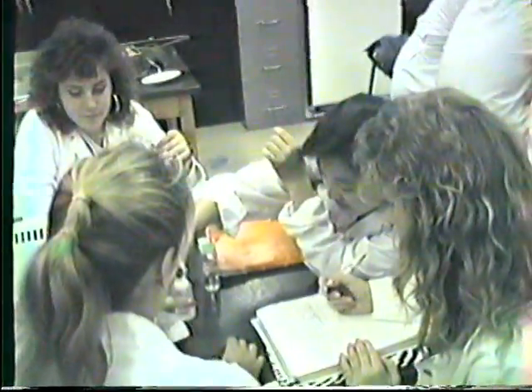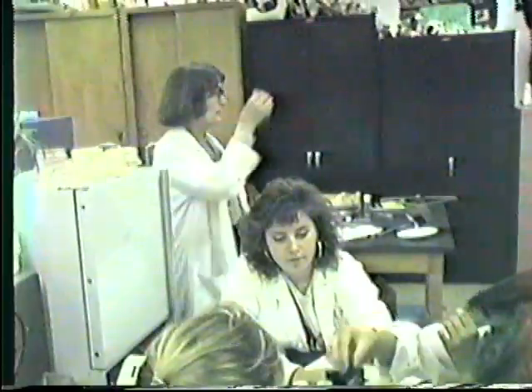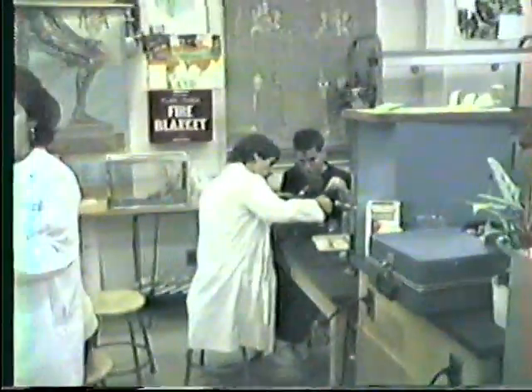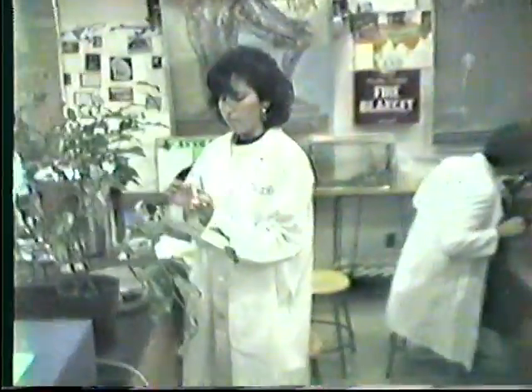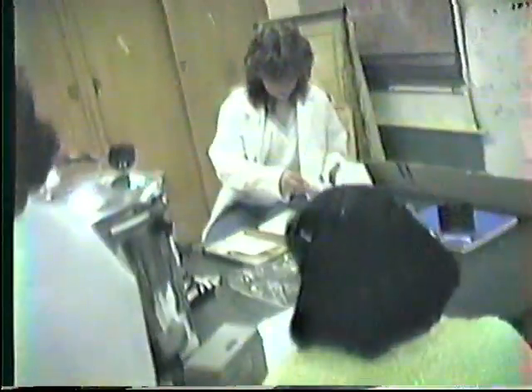But you also do turbidity, guys. You have to do it over, I know. I didn't need to. Someone can do turbidity test. No, just 2 drops. I did that before. Turn it on. Are you ready here? Call me when you're ready. Okay, no problem. Greg, you ready to do something? Yes. I just gotta wipe this off. But now it's just a mixture.